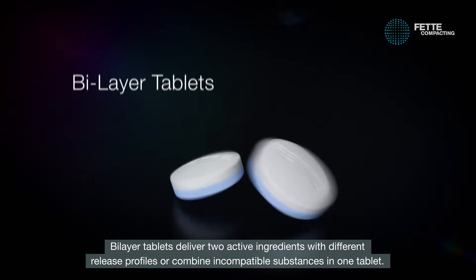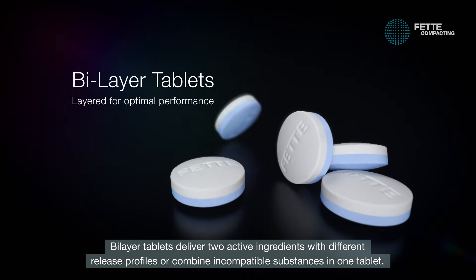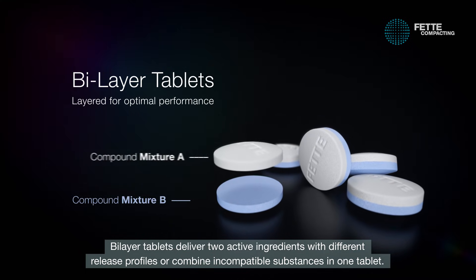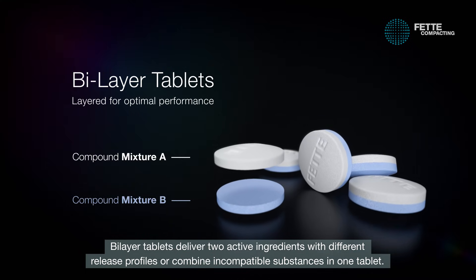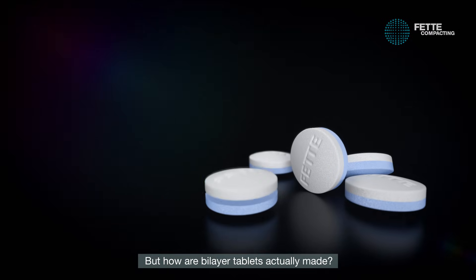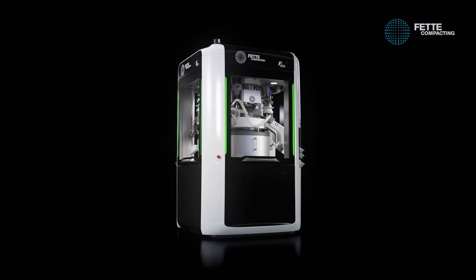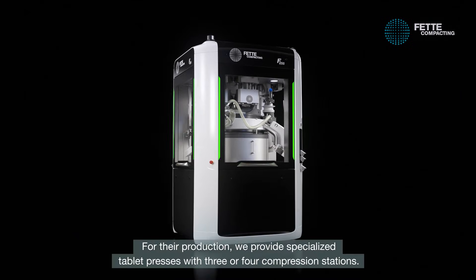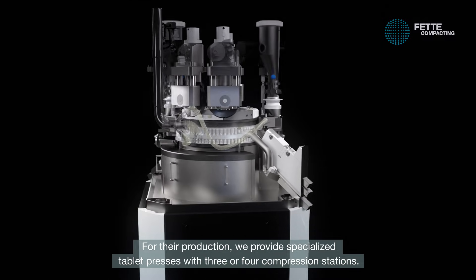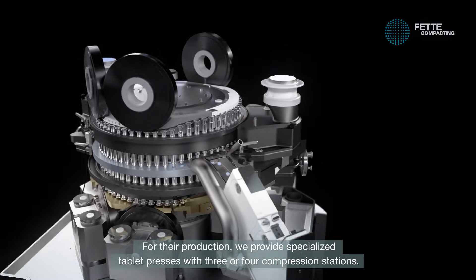Bilayer tablets deliver two active ingredients with different release profiles or combine incompatible substances in one tablet. But how are bilayer tablets actually made? For their production, we provide specialized tablet presses with three or four compression stations.